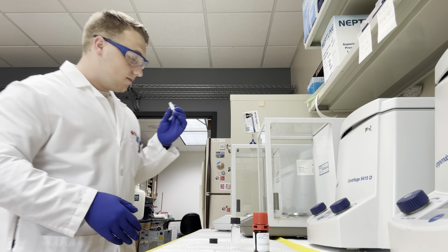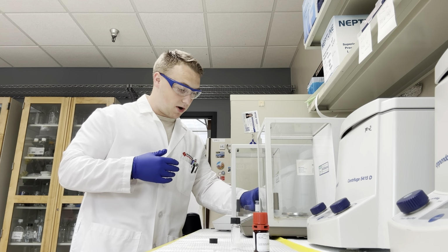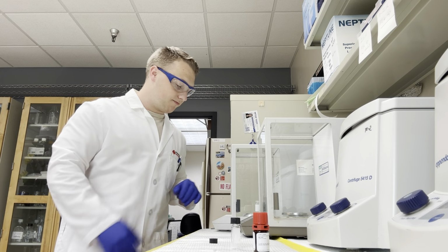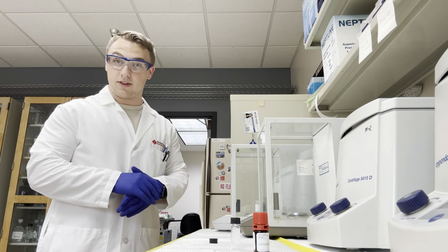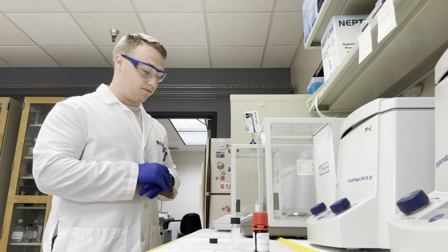So what we're going to do is put this on our little scale. I personally like to do it with the cap off. Then they have these little side doors. You're going to slide that closed, and you're going to press mode to zero. I don't think this is news to anybody, but we're just going to walk everything through.